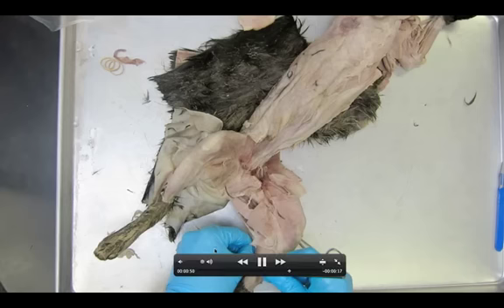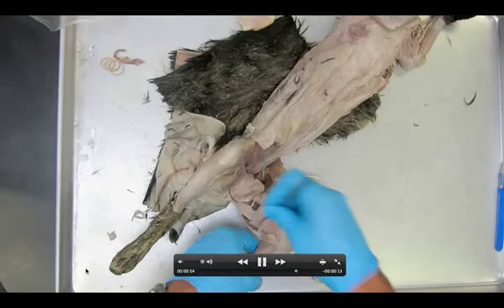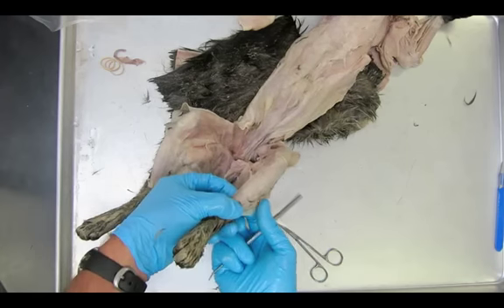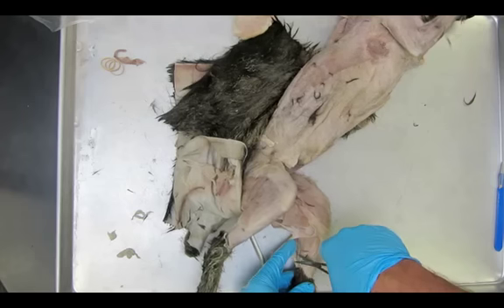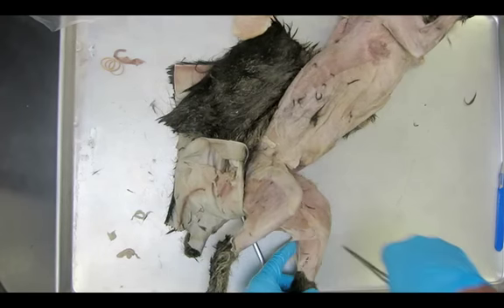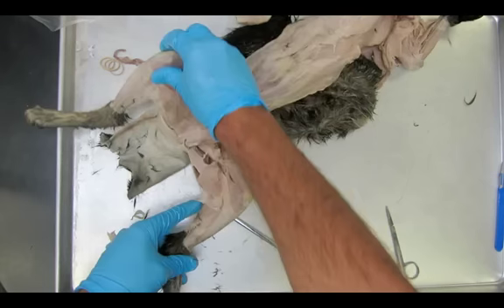So we're just exposing this. I believe during this video my camera runs out of battery, so we'll do a quick transition. I just want to show you we're removing fascia all over the place, moving it off of the sides. I'm going to use scissors to help me out as I remove and clean it up.